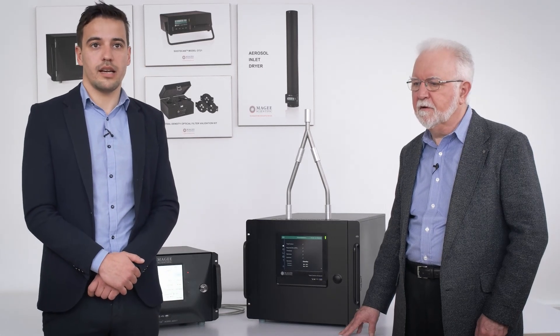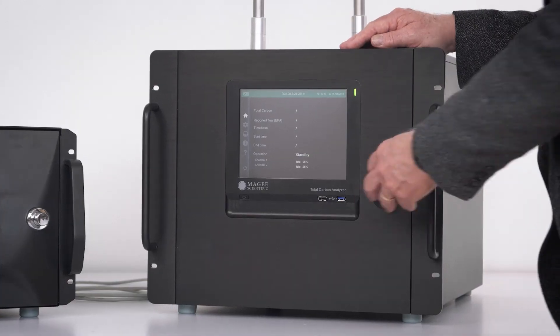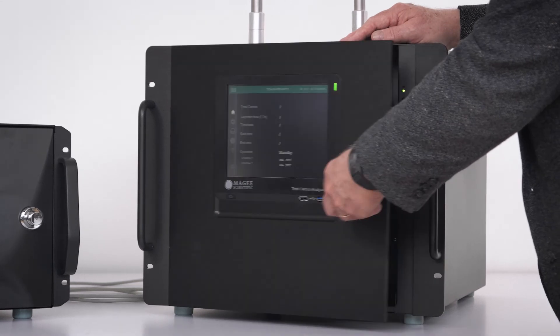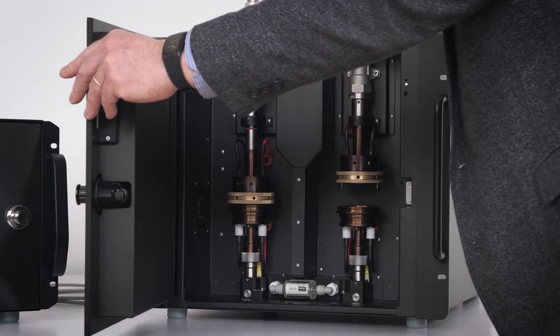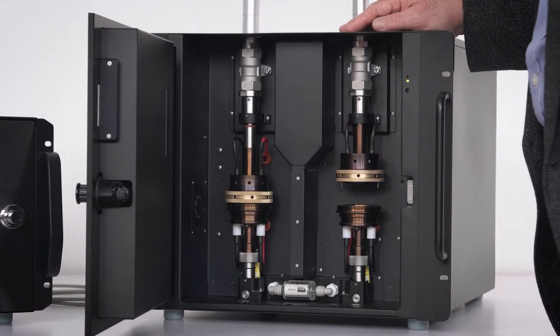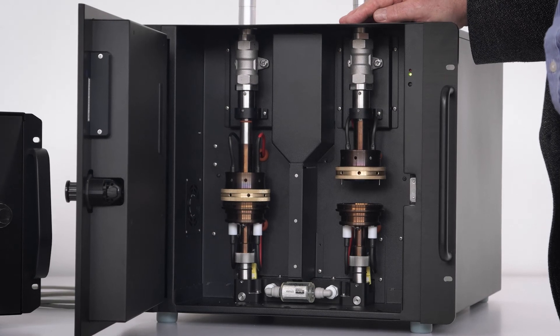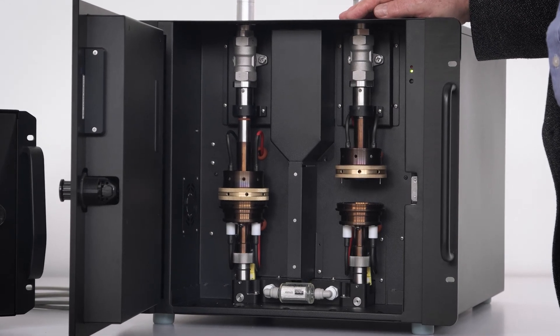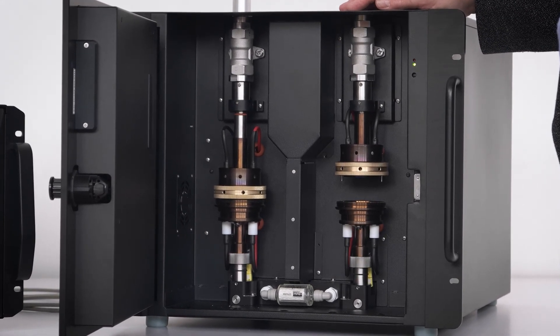Because we use ambient air as a carrier, no special gases are needed. The entire system is made from stainless steel. This makes the instrument rugged, reliable, and suitable for use at any location in the world.